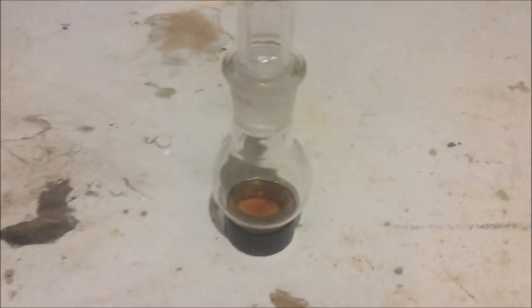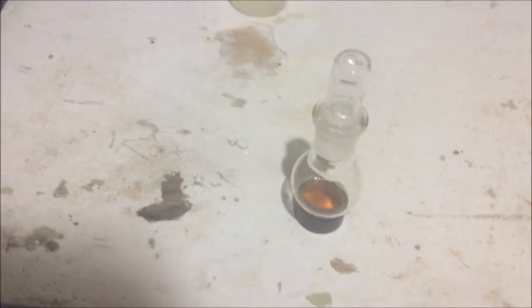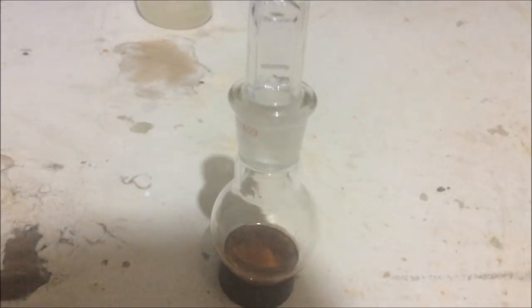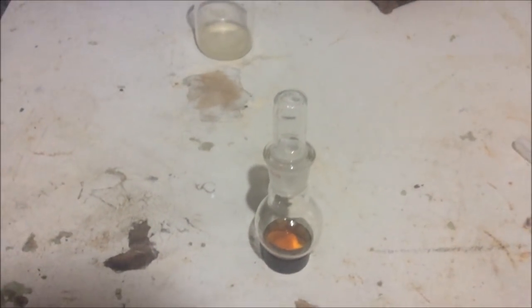All right, so how much orange liquid do we have? It is 2.25 grams, which is roughly 2.5 mils. Or if we assume that this is 100% pure, based on how much sodium terephthalate we had in that container, it's roughly 15%. So assuming, because all this orange stuff is going to be left behind when we distill the benzene, we're probably only going to get 5 or 10% yield based on sodium terephthalate, which is dreadful. So the question is, where did all those carbons go?